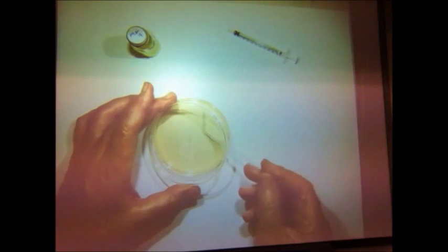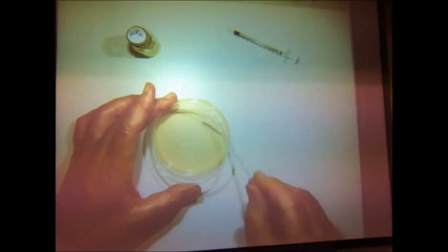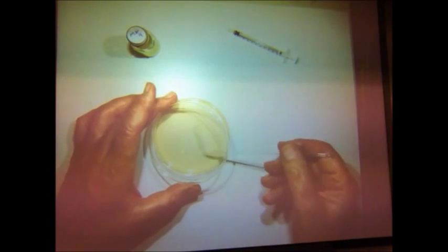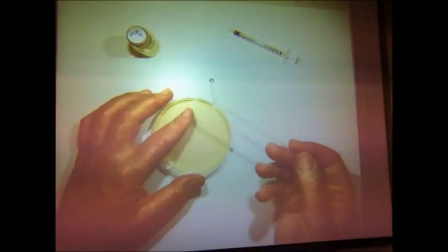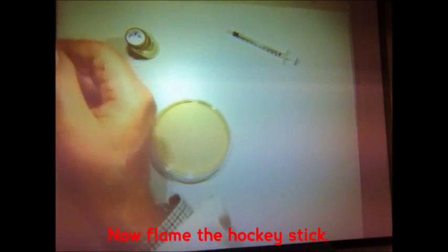Remember that most bacterial contamination will come down from above, so if you can protect the surface of the agar and your bacterial culture, you minimize the chances of contamination.